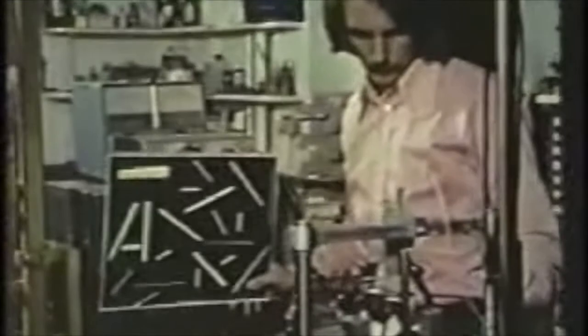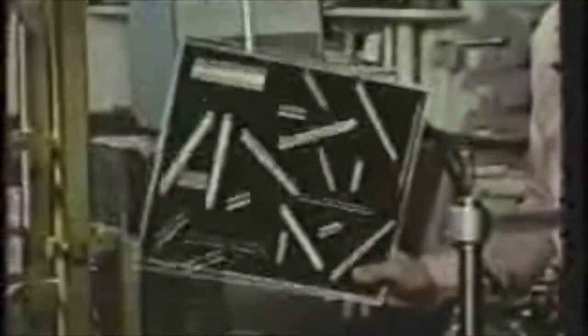Waving a pattern of lines in front of the cat's eye to help me find visually responsive neurons. Compared with retinal ganglion cells, cortical cells have rather little spontaneous activity. What you heard was some action potentials growing out of the background noise as the electrode approached a cortical cell. This neuron clearly responds to something on the patterned card.